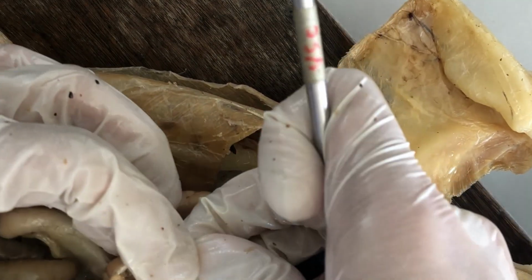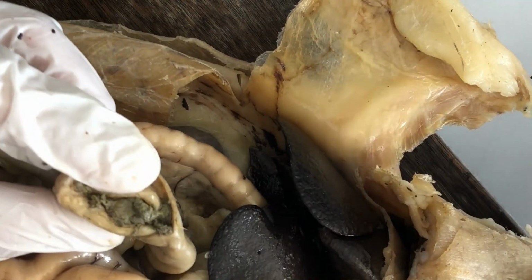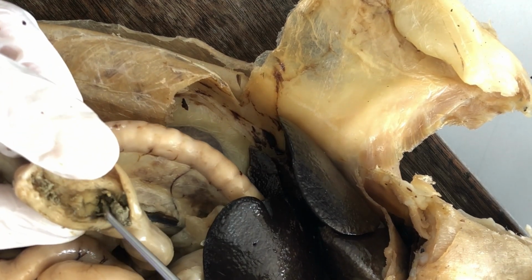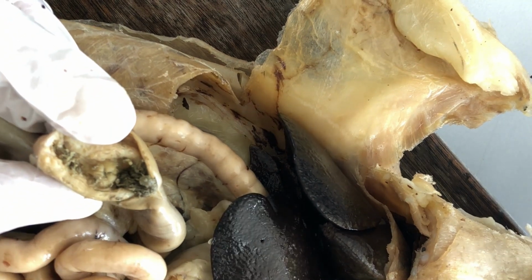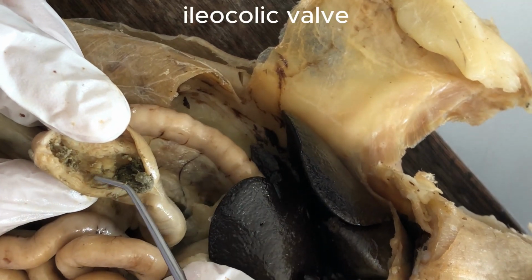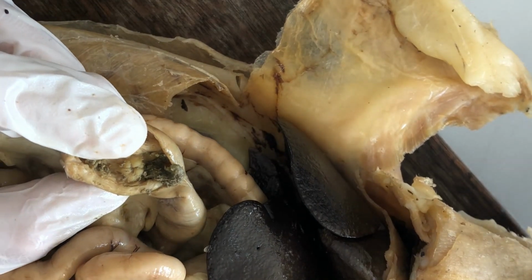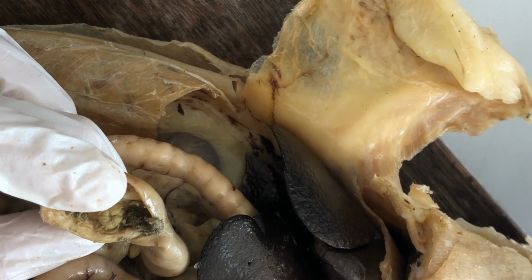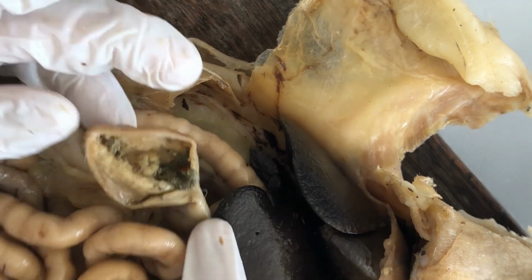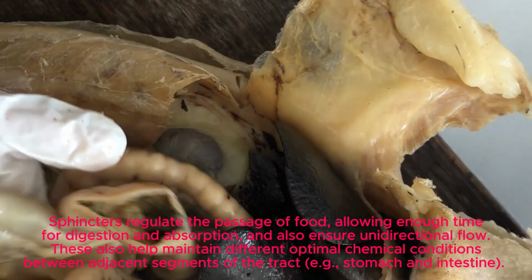Oops, there is lots of fecal matter. You have to clean it, wash it, to be able to see that puckered structure there. That puckered structure there is called the ileocolic valve. Another sphincter. There are lots of sphincters regulating or controlling the flow of digesta into the alimentary canal. So that the flow isn't continuous, they have to stop first, for example, in the small intestine for complete digestion and absorption before they enter the large intestine.